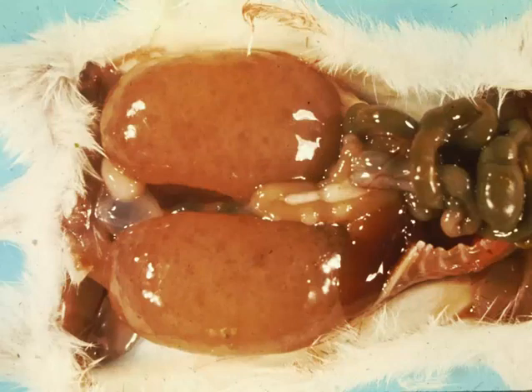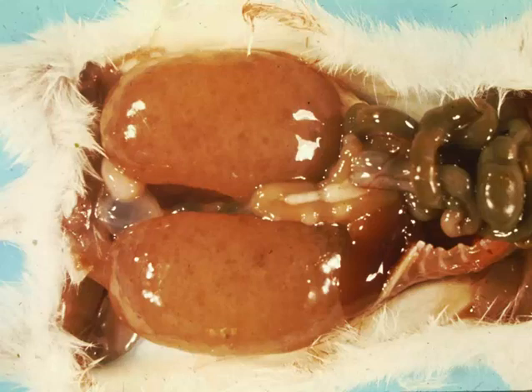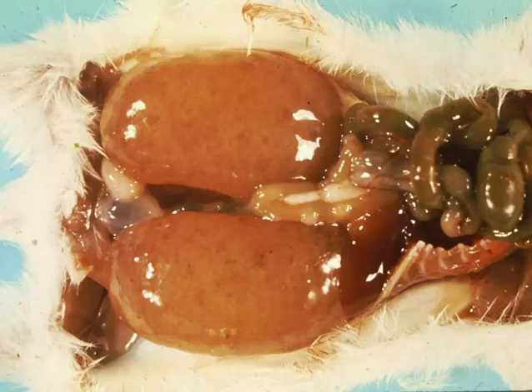Another cause of greatly enlarged kidneys is spontaneous models of polycystic kidney disease. The autosomal recessive forms mimic what we see in dogs, cats, and humans — the kidneys are absolutely huge, almost at birth, due to almost totally defective formation and connection of these kidneys, possibly due to an associated ureteral misplacement defect documented in humans. The key to the autosomal recessive forms — the very severe forms — is the animals are born with these huge kidneys. In the dominant forms, they often take months to a year or two to manifest. These kidneys have just huge dilated tubules and nothing really works — the animals usually succumb shortly after birth.